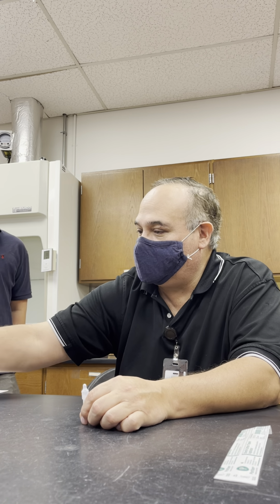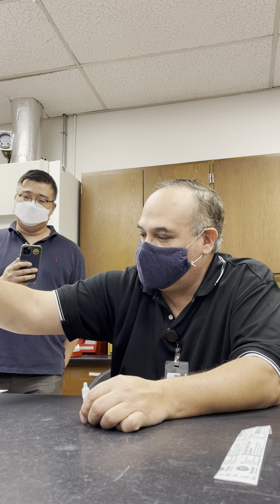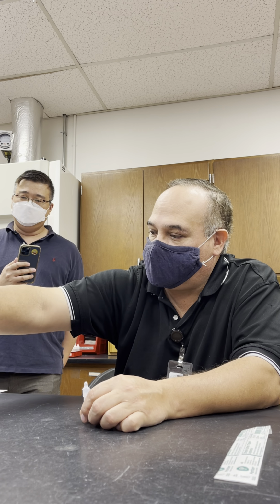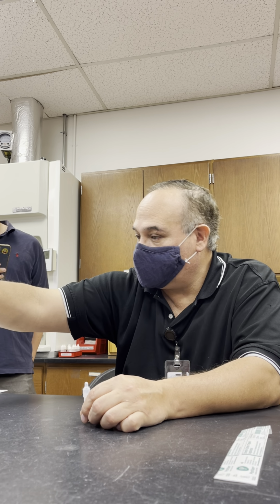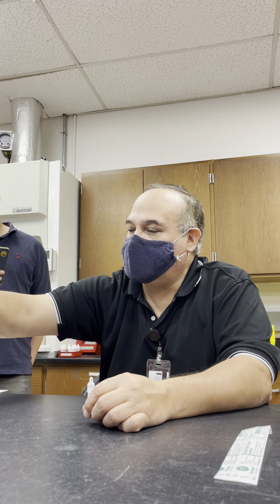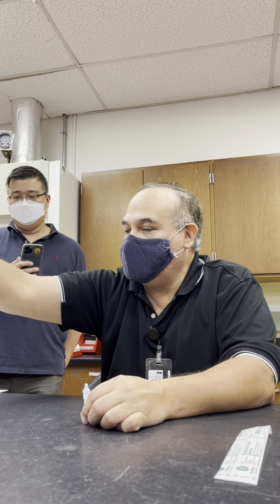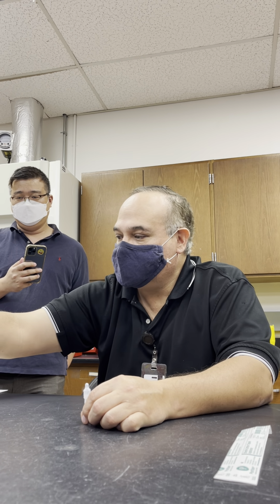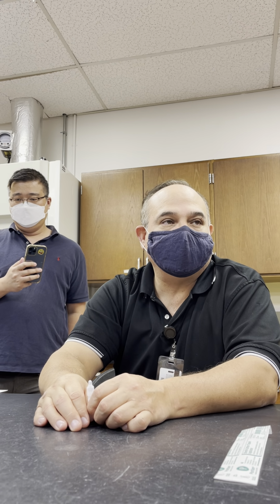There you go. Good? So if we do this test, I'm going to divide these up into different categories. All these organisms right here, Proteus, Enterobacter, E. coli, Salmonella, and Klebsiella, all these six, they're enterics. Enterococcus faecalis is gram-positive, and Alcaligenes faecalis is a non-enteric.